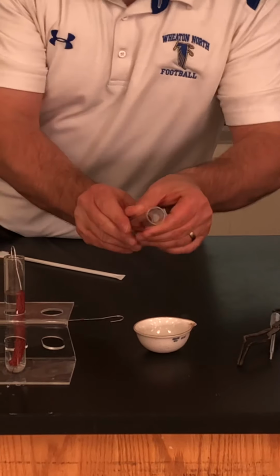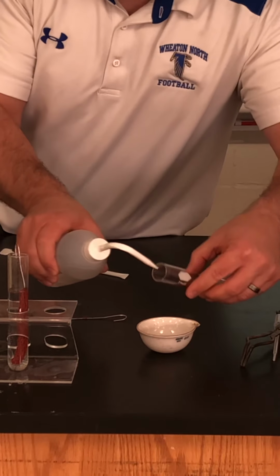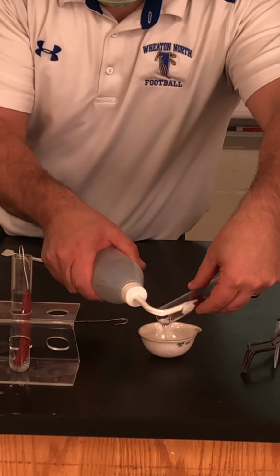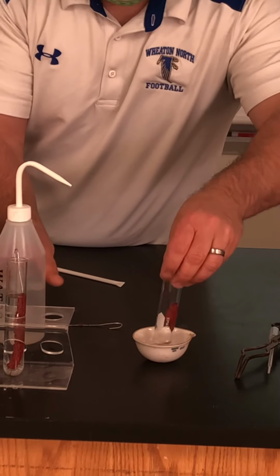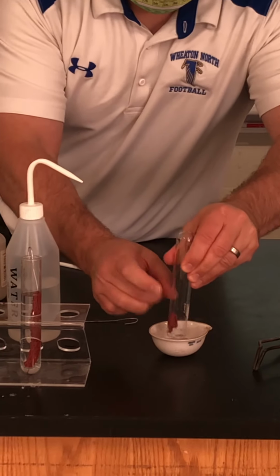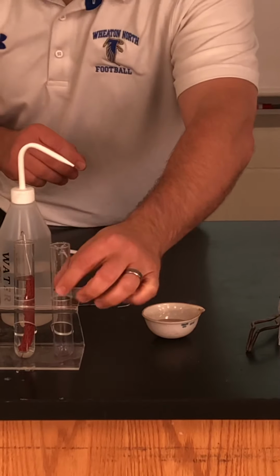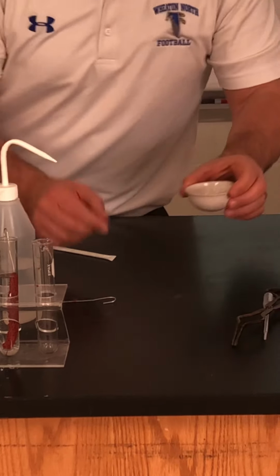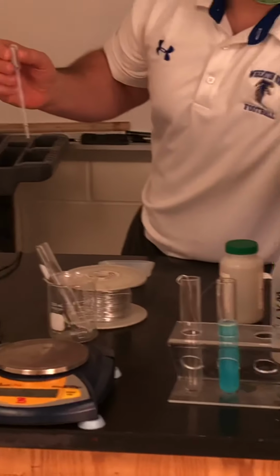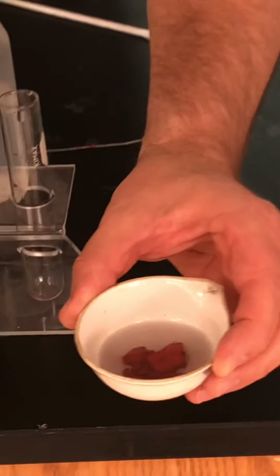And you might need to, in your lab, add a little bit of extra water just to get that copper to pour into the evaporating dish. Now what I'm going to do is using a pipette, I'm just going to suction off the additional water. So if you look here, you can see that you have your copper along with a pretty fair amount of water that's in that dish.